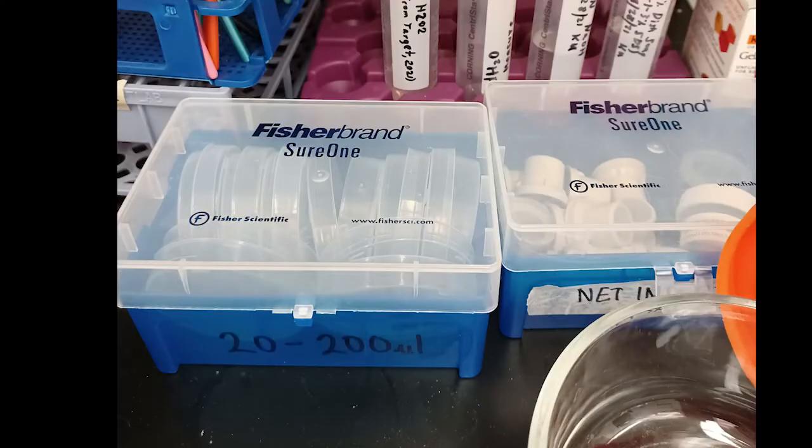In case the lids did not come with the netwells when you first arrived though, you can find them in this blue box on the left pictured here.